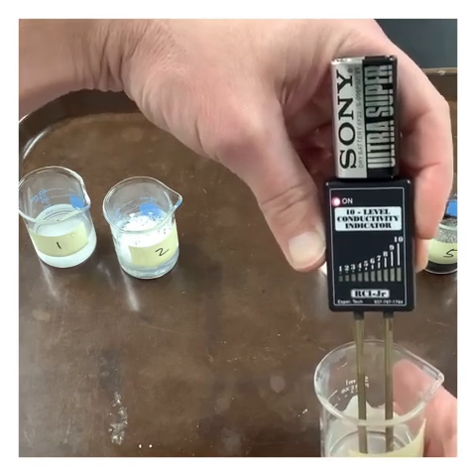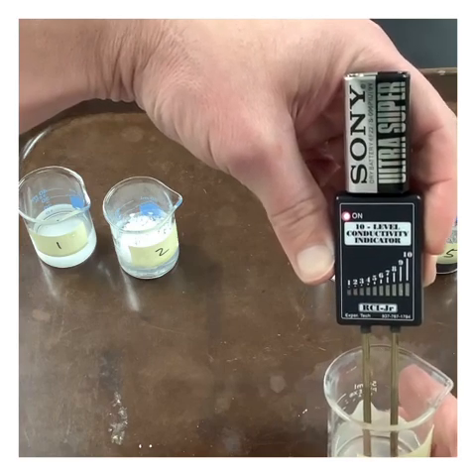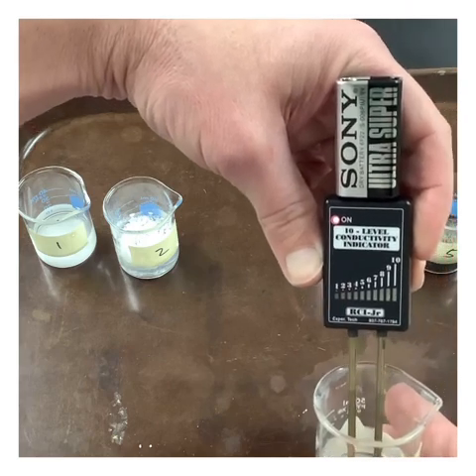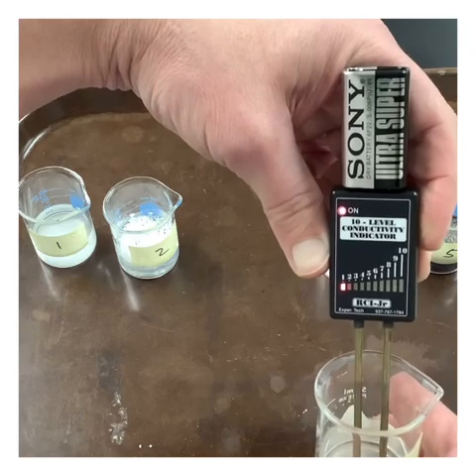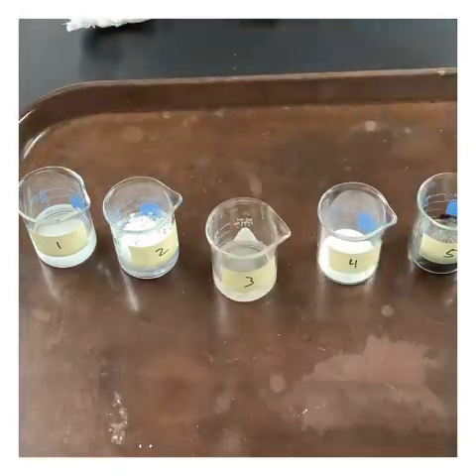So remember, like I said, sometimes we just get a little bit of dirt or a little bit of impurities and we're just getting barely a tiny bit. It's probably just dirt, right? It's not even super constant. So let's go ahead and say no on that one.